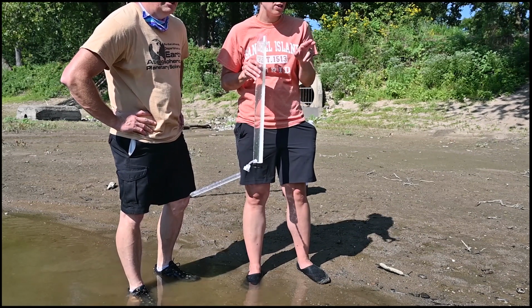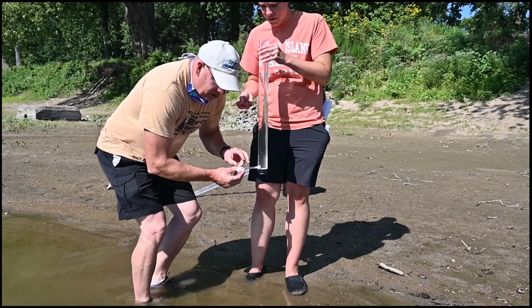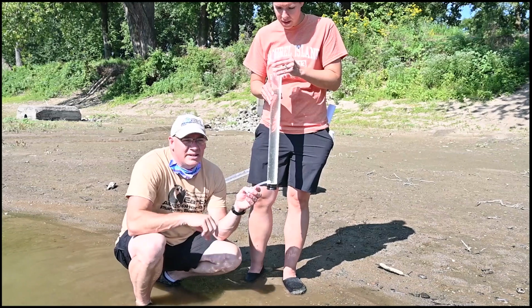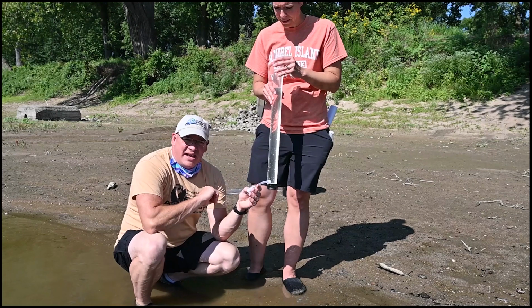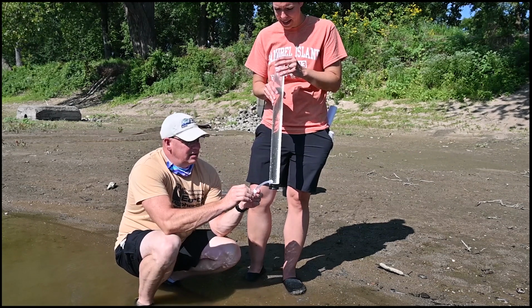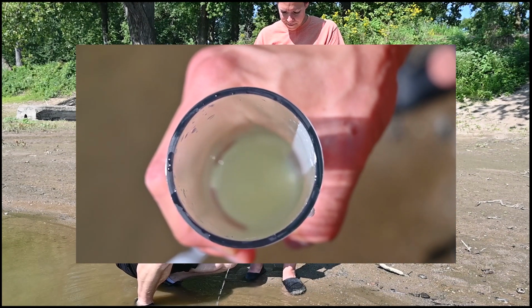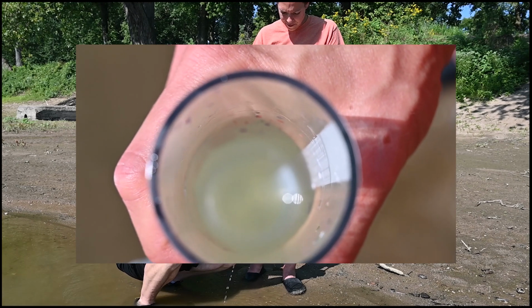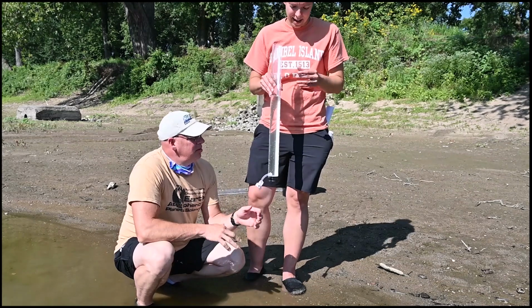I can't see the separation between the black and the white on the disc. So what we're going to do is work together. You always want a partner. I will release, but as soon as she can make out that disc, the difference between the black and the white sections, she's going to say stop. And I'll close this up as fast as I can at that point. Ready? I'll let that come out. Okay, stop. I can see the black and the white now at this level.